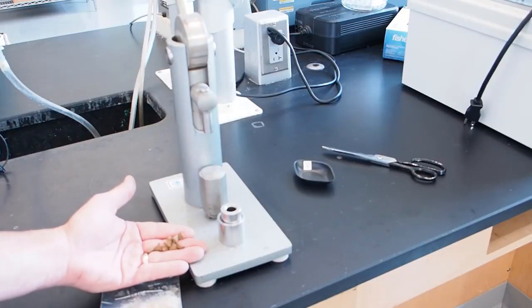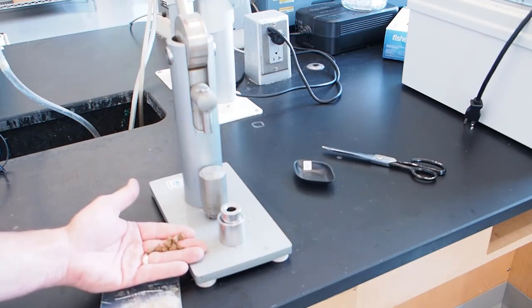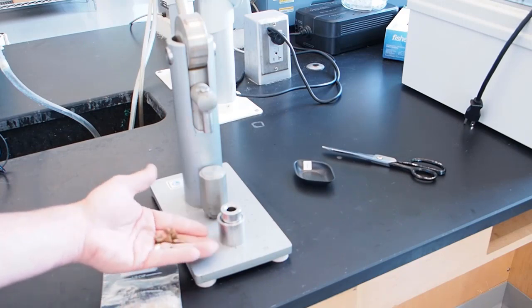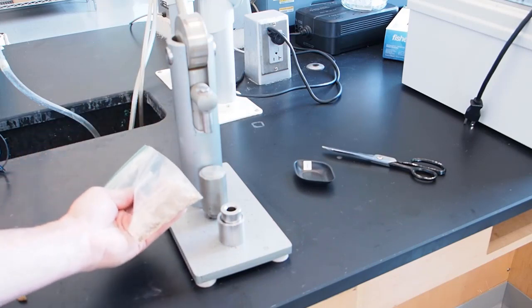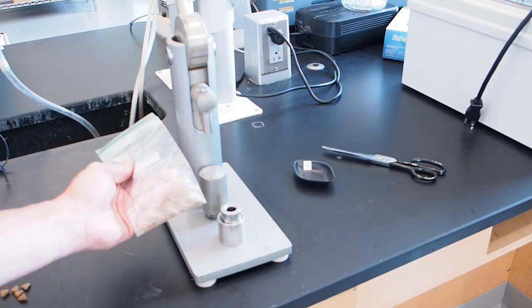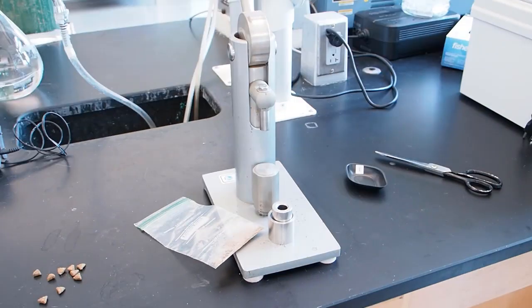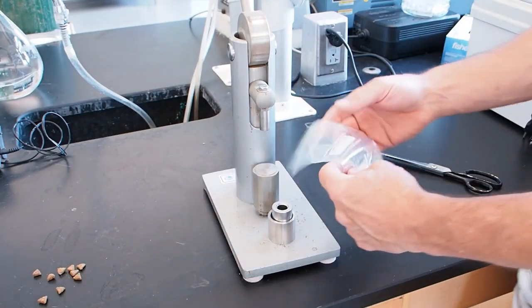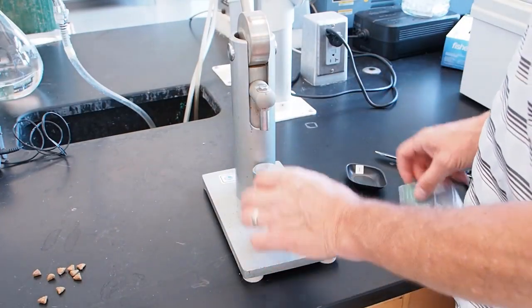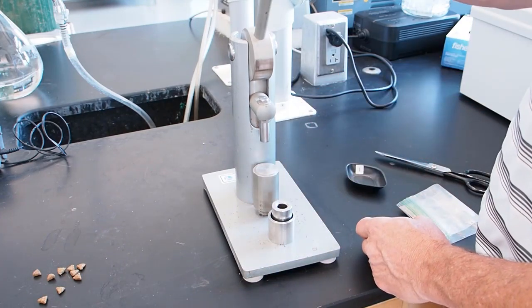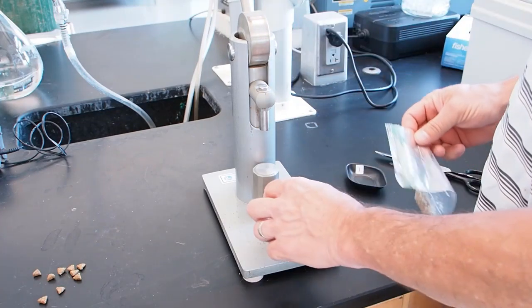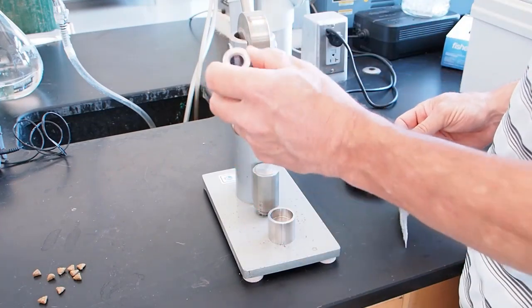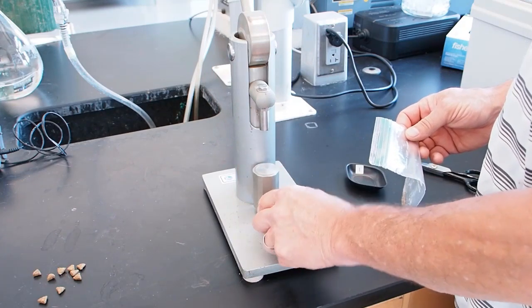In order for the reaction to go to completion, the food needs to be in tiny particle sizes. And so what we do is we've taken the kibble from the dog food bag and we've crushed it up into a powder. And now we're going to take that powder and make a pellet out of it. This is called a pellet press. And the way it works is it has this kind of piston here that's going to go down and push on our powder and press it into a pellet. And the powder is going to go in this little holder here, and it's going to press against this bottom piece of metal here.